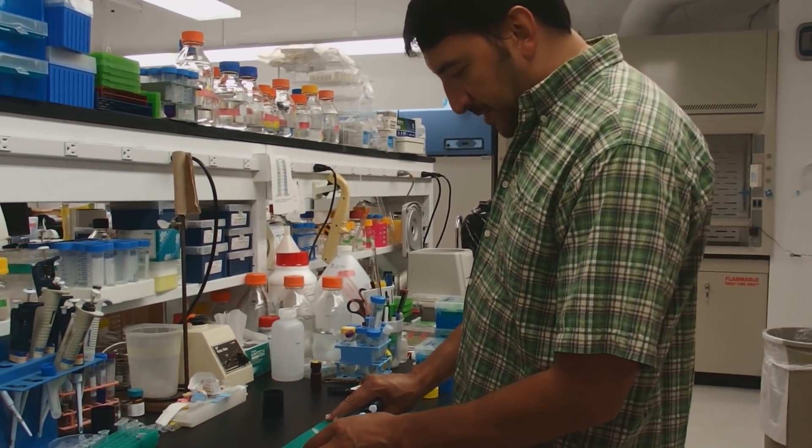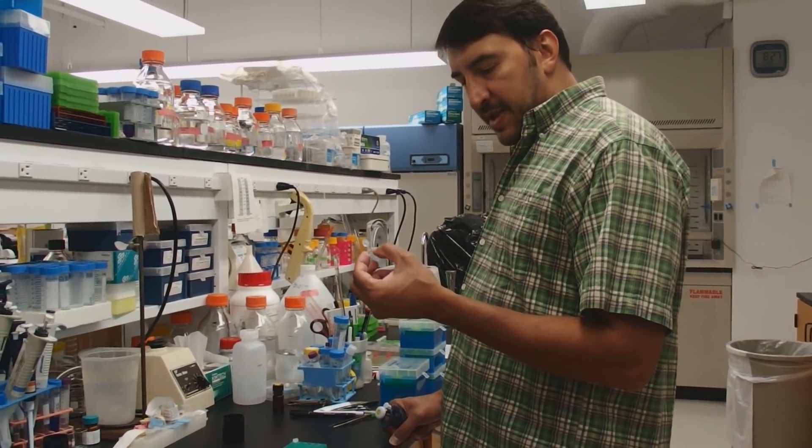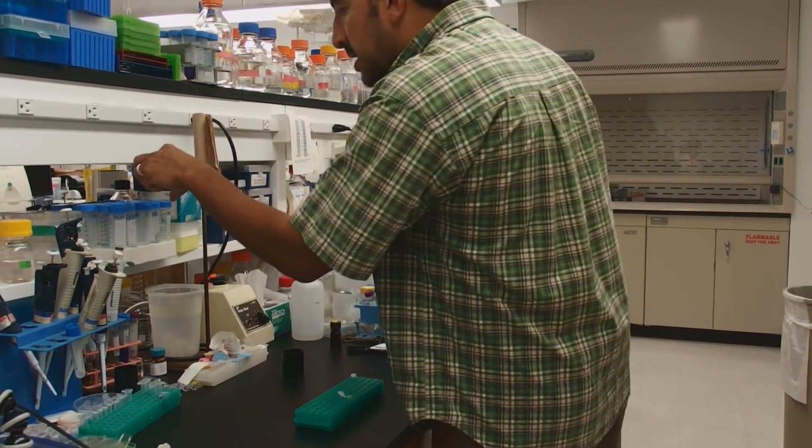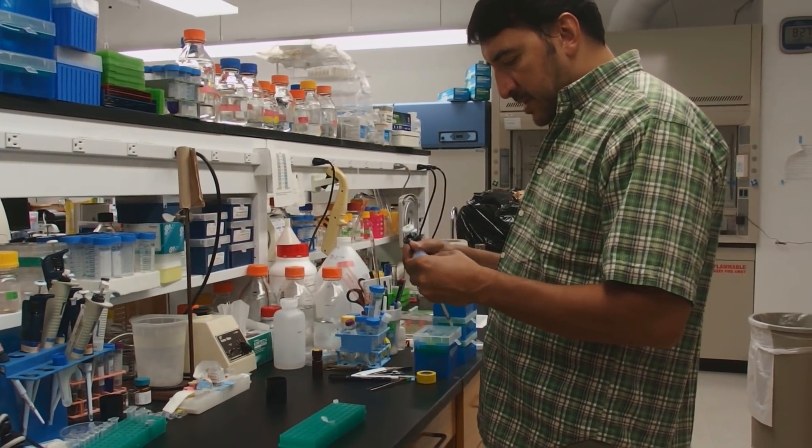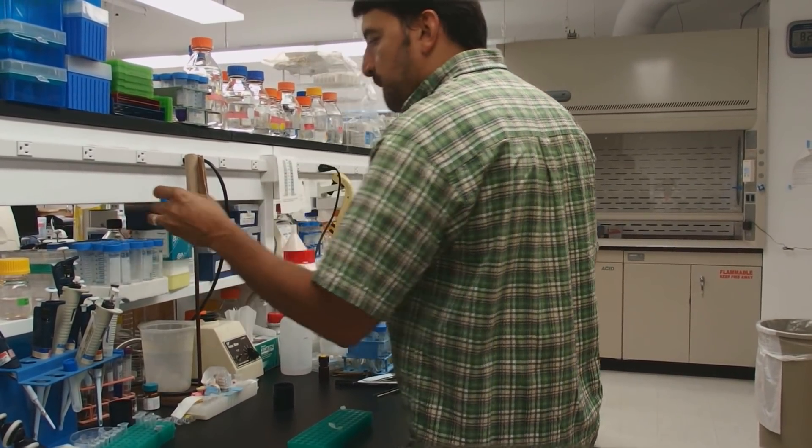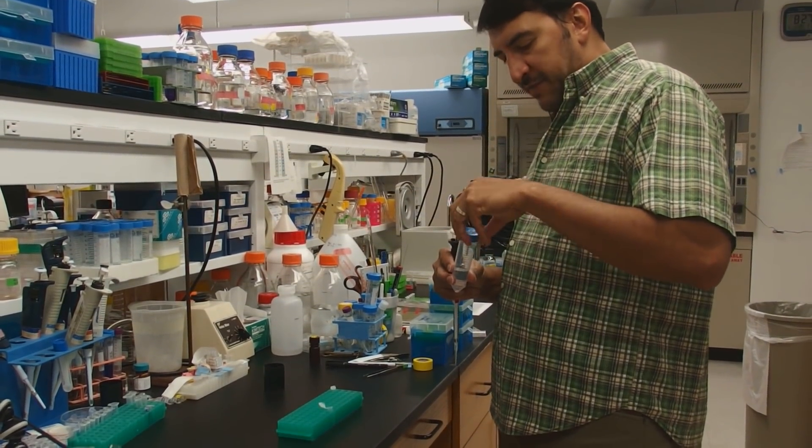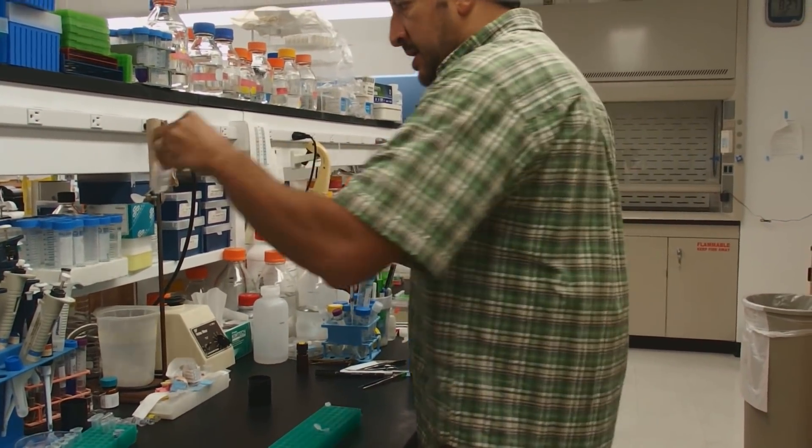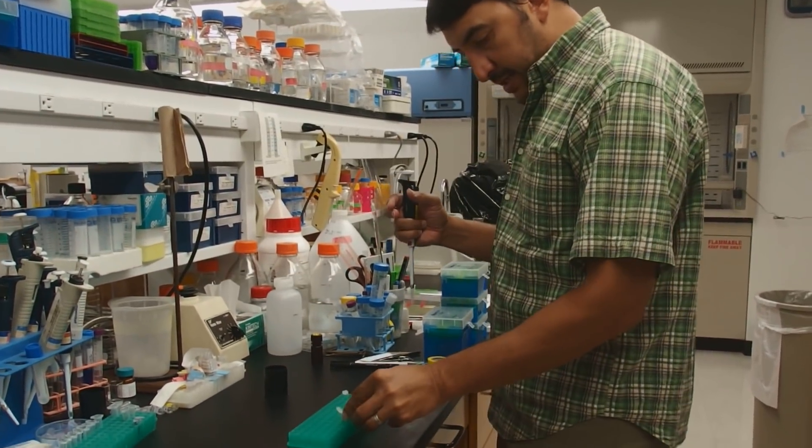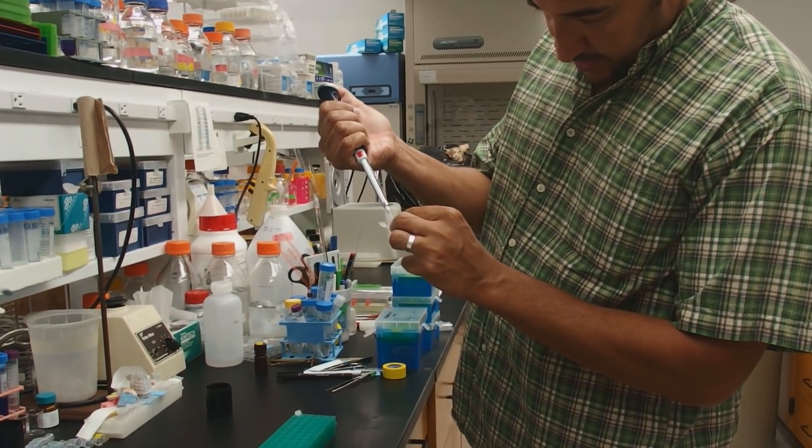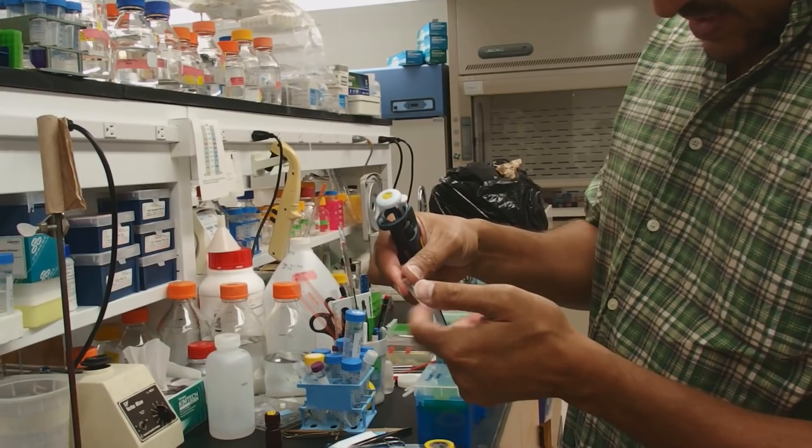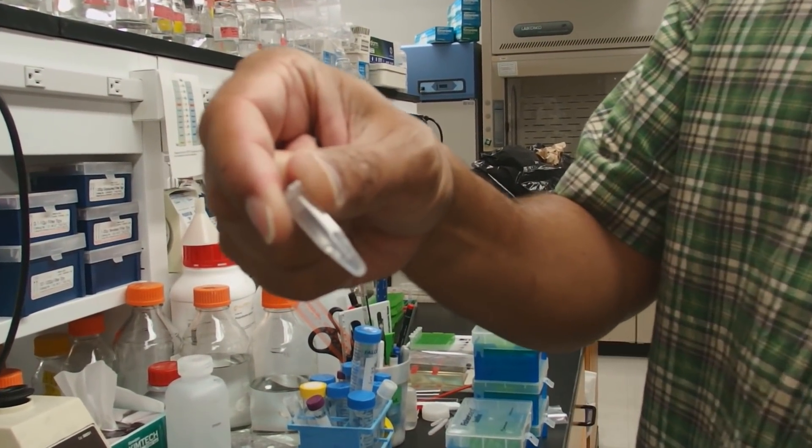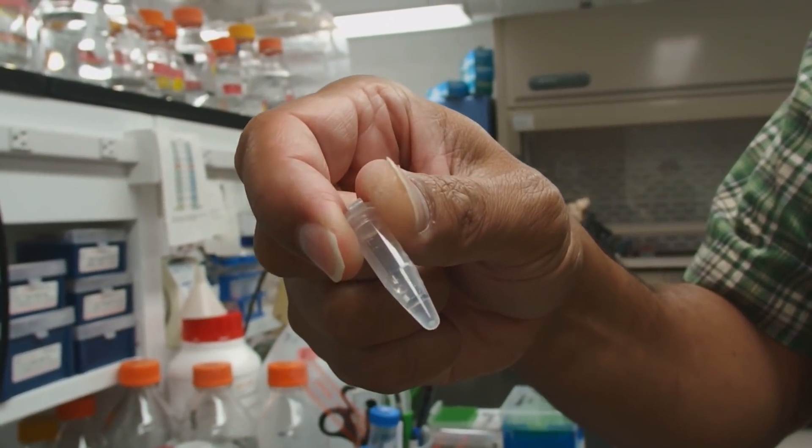All right. Our DNA is now drying up. You don't want to over dry it. If you over dry genomic DNA, it may not go back into solution very easily. By drying on your bench, of course, you don't have a big risk of that. But a tiny amount of ethanol won't even hurt most of the downstream applications. I'm going to resuspend this by just adding the TE buffer directly to it. That's a big pellet. So it's going to take a little bit for it to go back into solution.